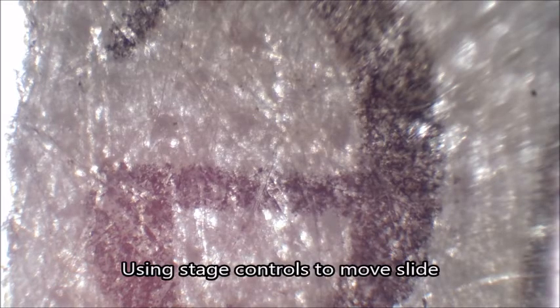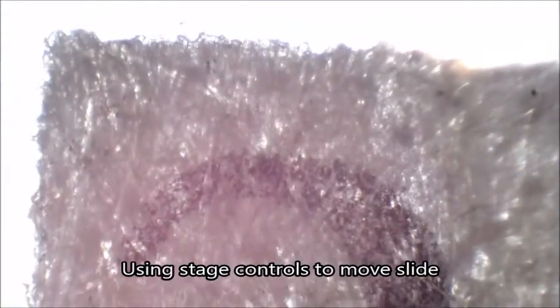So that's in focus. Now I can use the fine adjustment to fine tune it. See how I overshot it then and it went a bit cloudy. All right, yeah. So that fine focus just gets the picture even more crisp. Now I'll show you what it looks like when I use the stage adjustment knobs or stage controls. See, I can move it either way, up and down, like I showed you, and side to side.